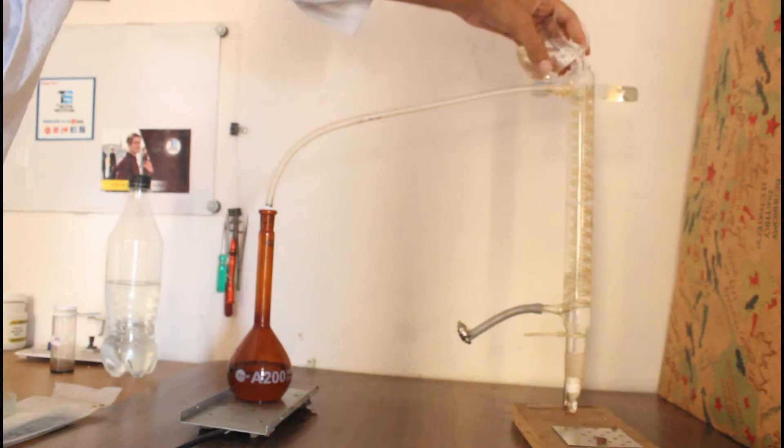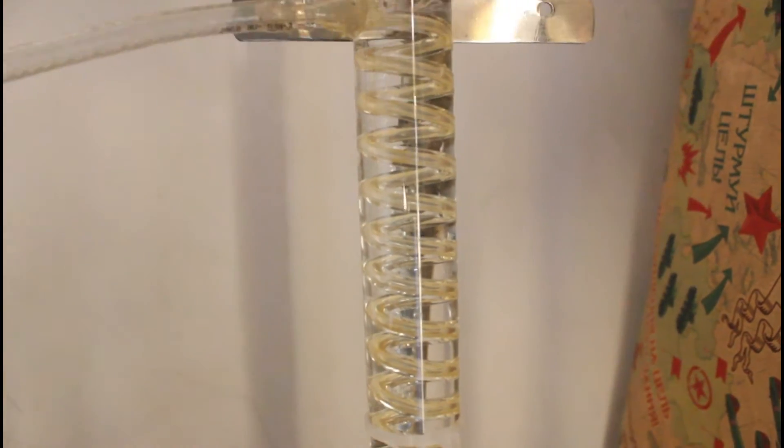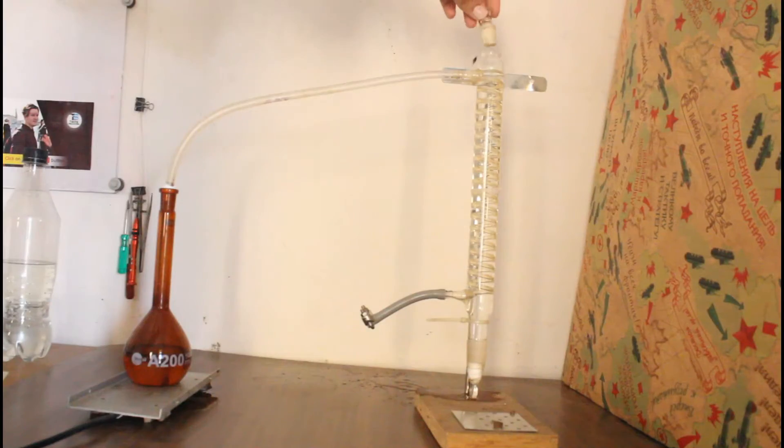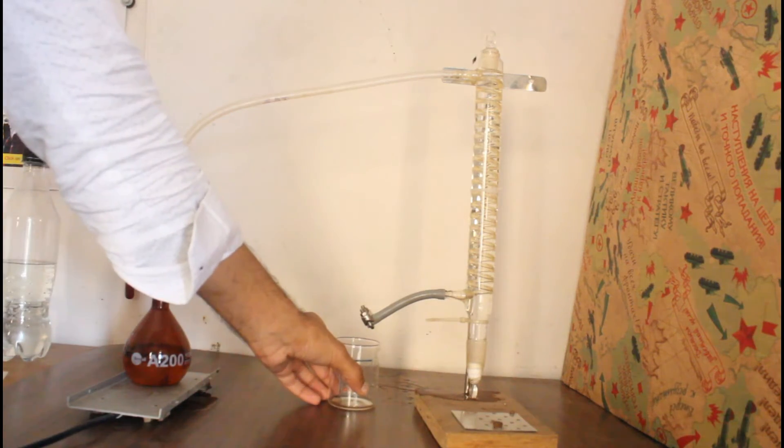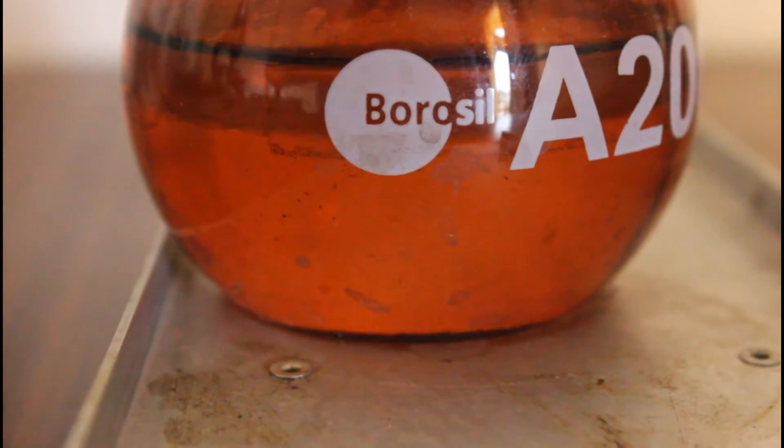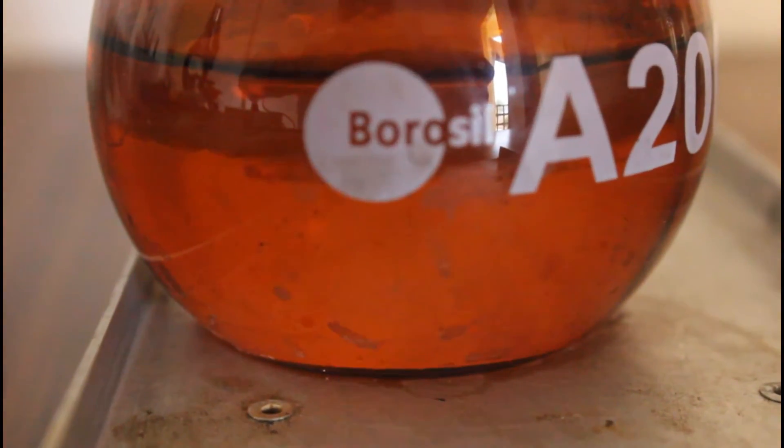Okay, now we can start collection and I already started. As you can see some of the bubbles rising.